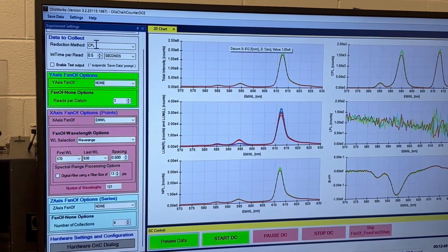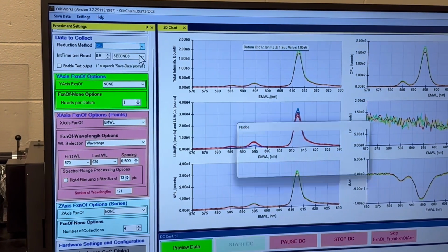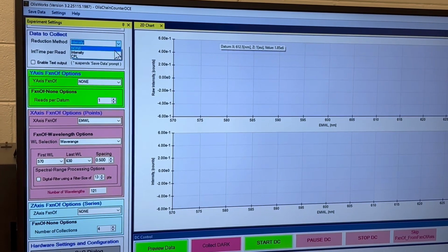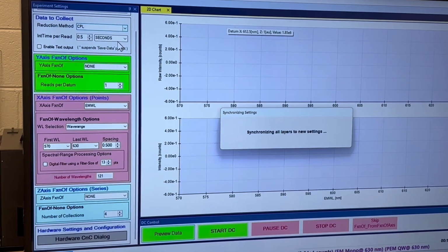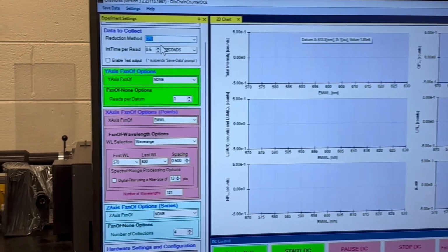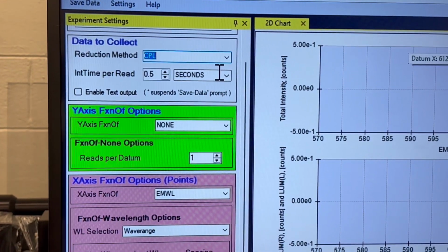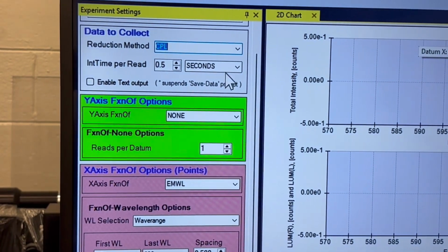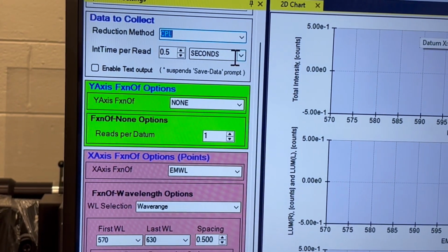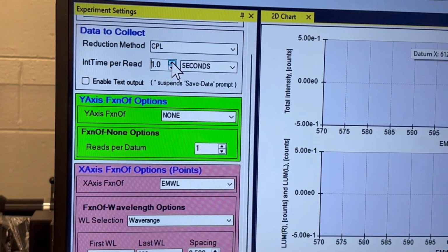At the top, I've chosen to deal with CPL. I could look at just intensity, as I might if I'm wondering about fluorescence, but in this case, I'm dealing with CPL, so I've selected that. And I've told it each initial read is only a half a second. The reason that I had it set earlier at a second is that the very tall, highly luminescent peak at 612 overloaded. So I came in here and turned this down to a half a second.